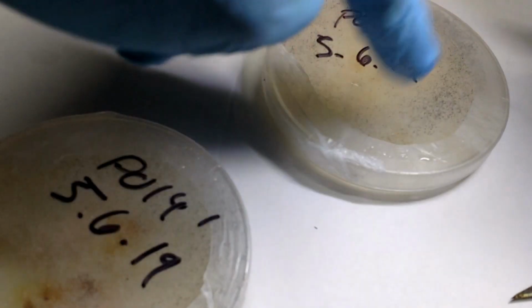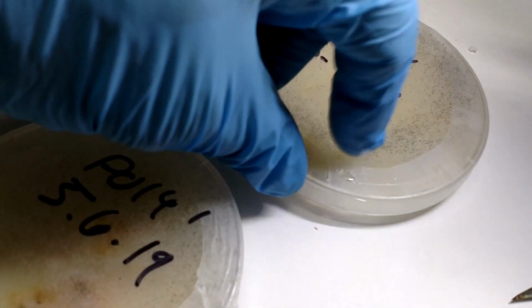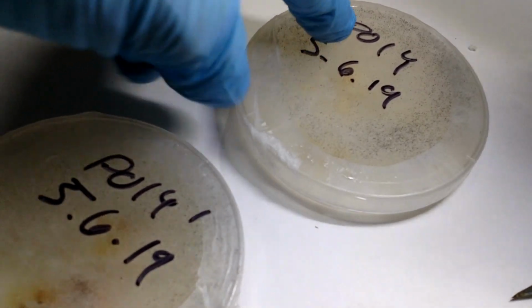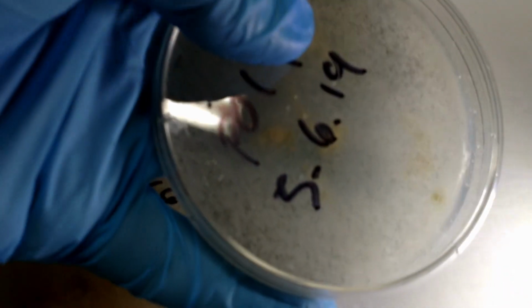Let's say you've got some good mycelium on half the dish, and there's some contaminant over here. Take your sample from the clean spot, and against my better judgment here, let's peel this open and see what it looks like. If you're queasy, you may want to leave the room now. Yeah, you can see that that's three-dimensional. I'm only going to give you a shot of it because I don't want to leave this open all day.